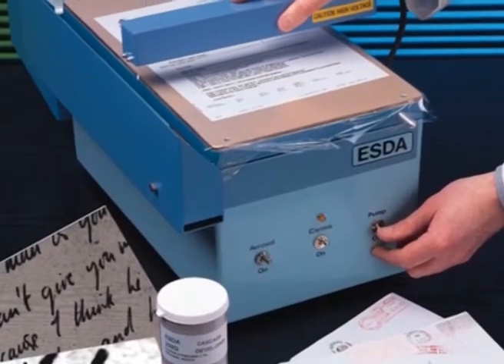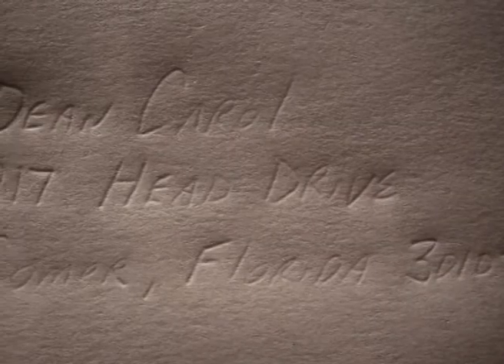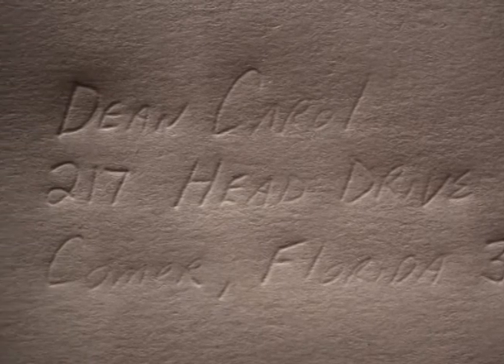The ESDA technique is based on the theory that the paper sandwiched between a grounded platen and mylar charging film acts as a capacitor, with the change in capacitance due to differing compression of paper. This led to models like thickness variation theory and surface variation theory. Indented writing is a writing formed on a sheet of paper underneath the one on which the original writing was done. For example, if someone writes on the top sheet of a notepad, the pressure exerted by the pen or pencil is sufficient to indent the papers beneath.